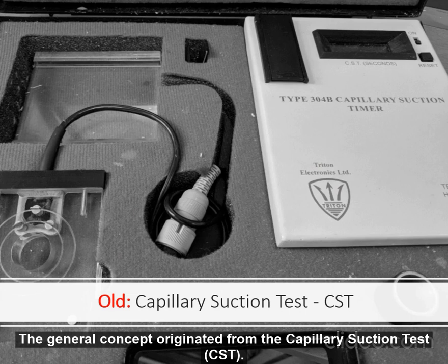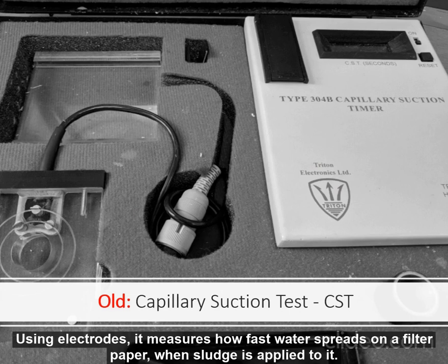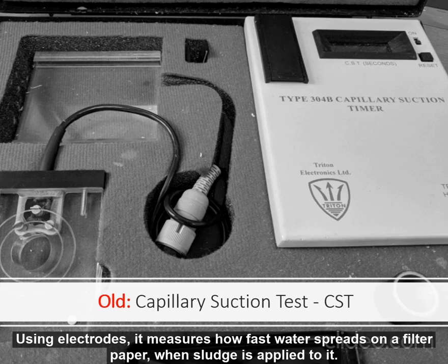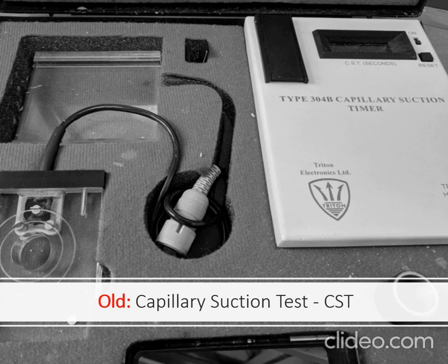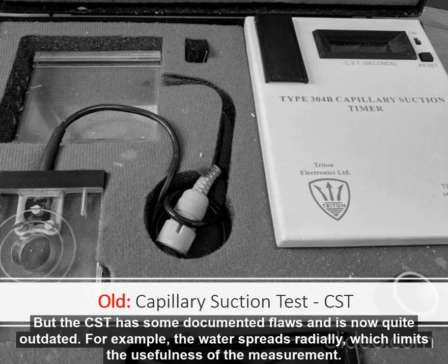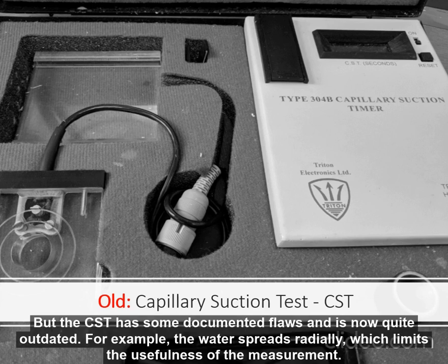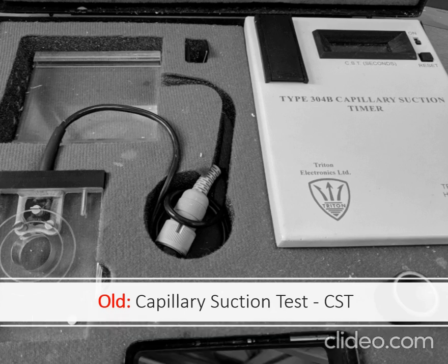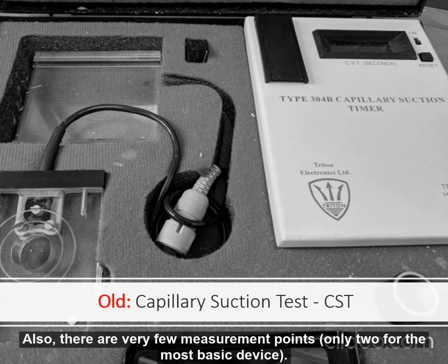The general concept originated from the Capillary Suction Test, CST. Using electrodes, it measures how fast water spreads on a filter paper when sludge is applied to it — the water spreads by capillary suction. But the CST has some documented flaws and is now quite outdated. For example, the water spreads radially, which limits the usefulness of the measurement, and there are very few measurement points — only two for the most basic device.